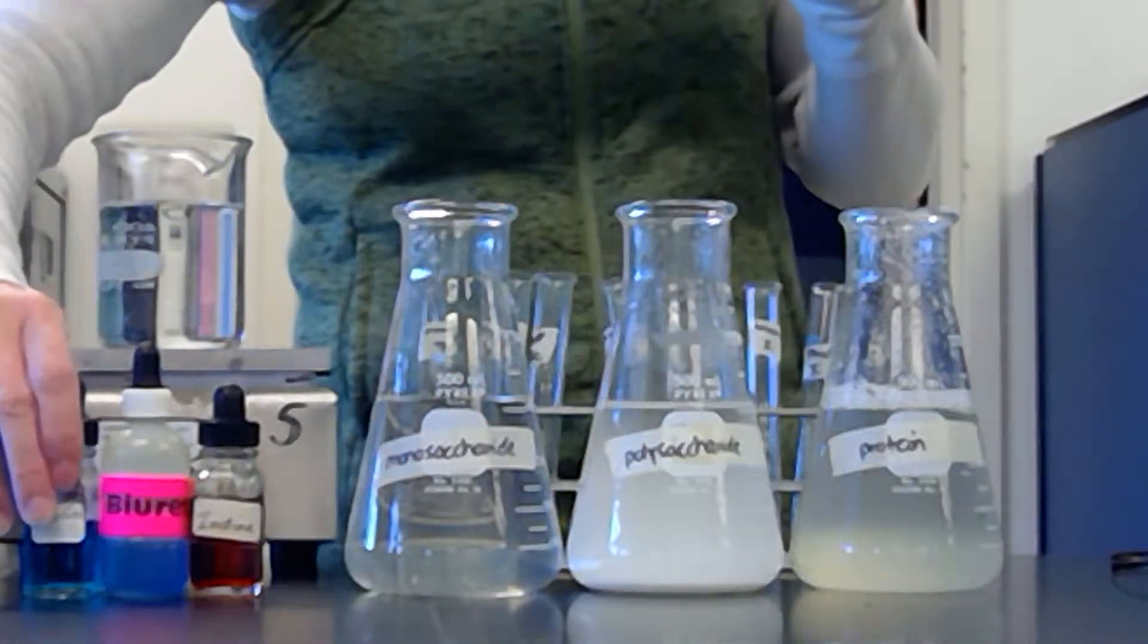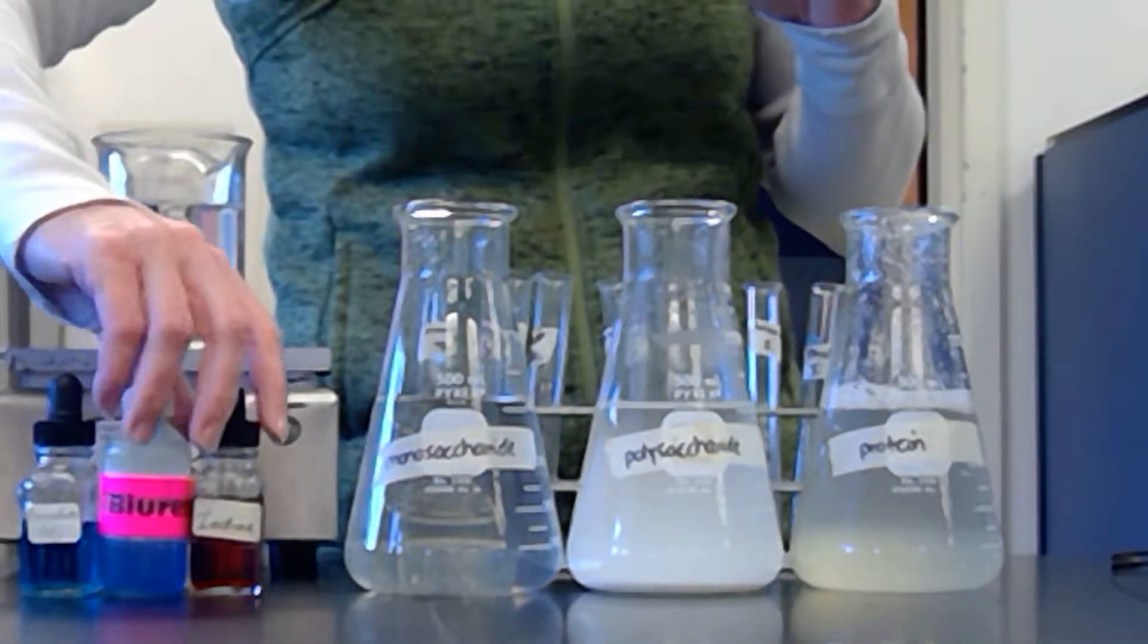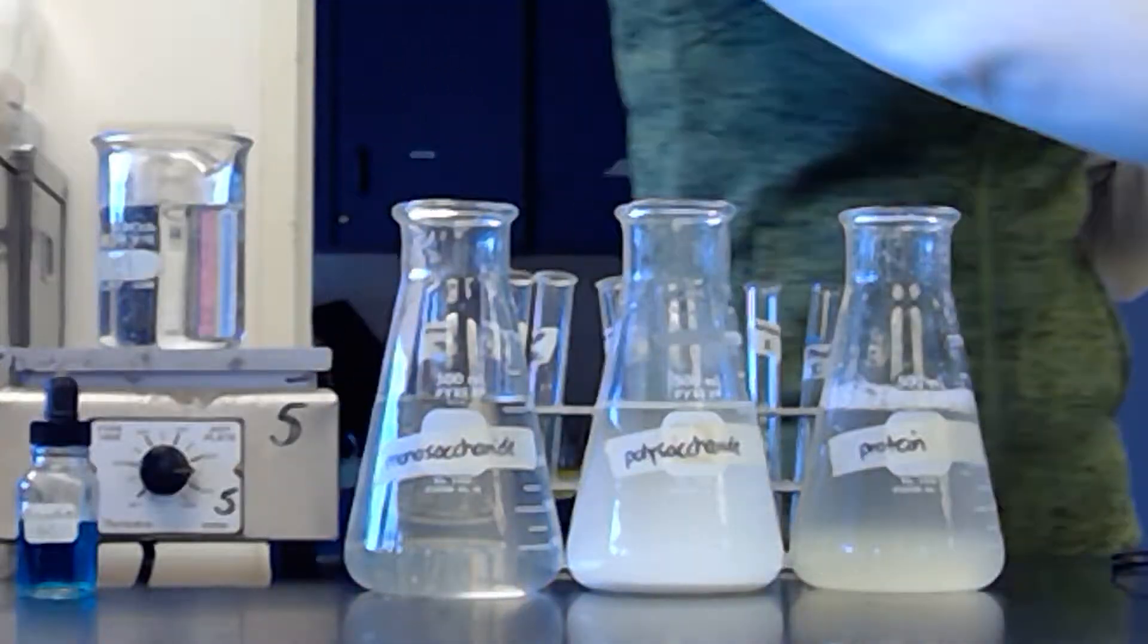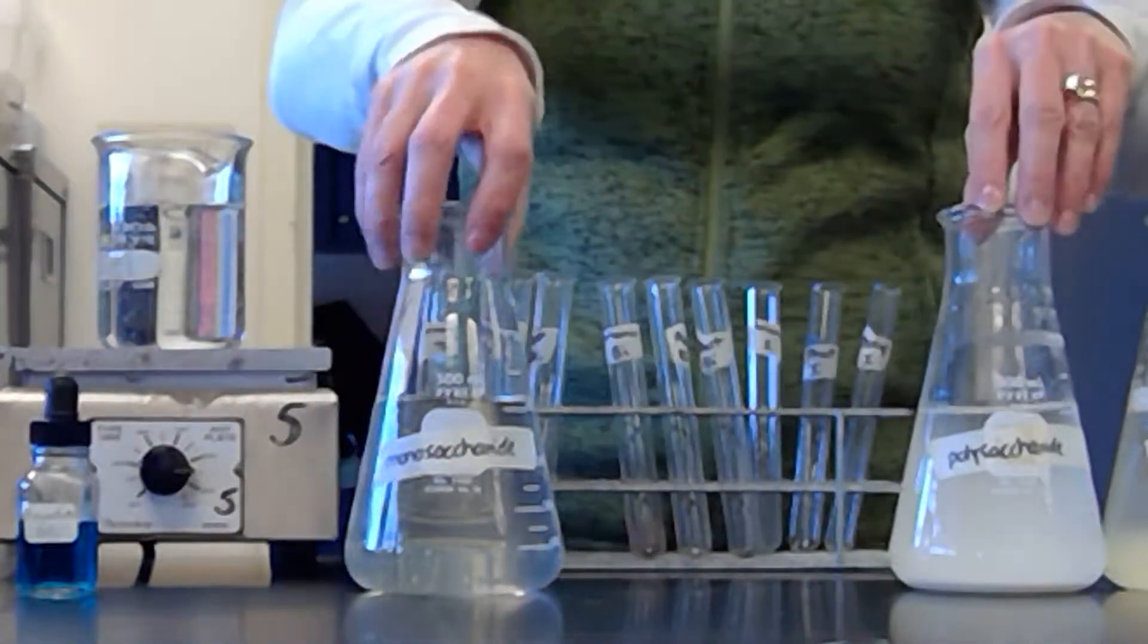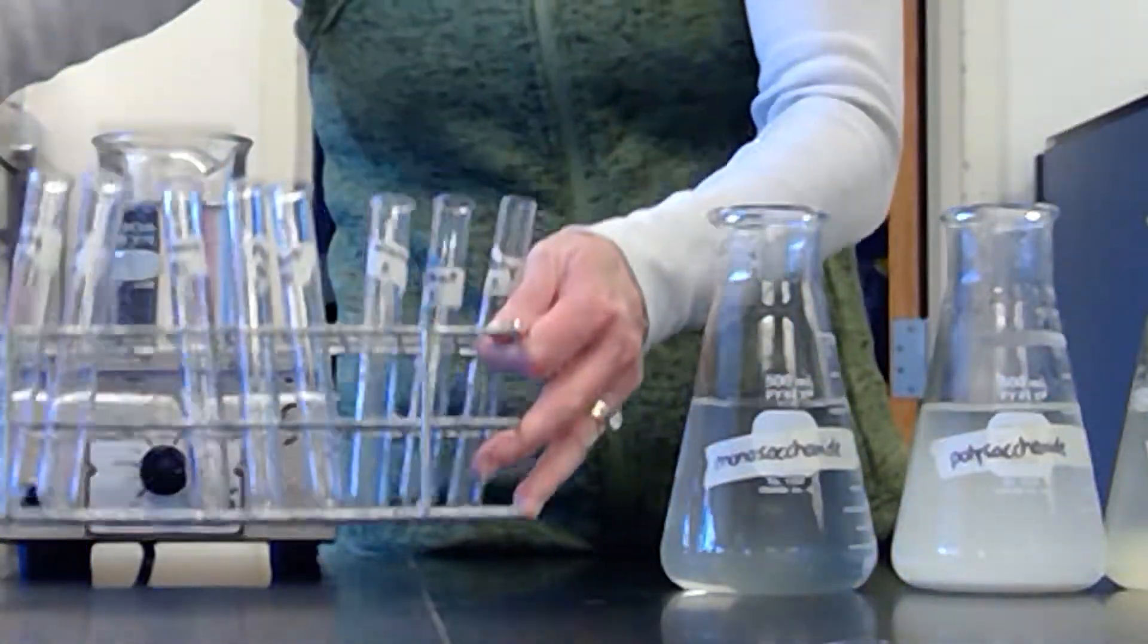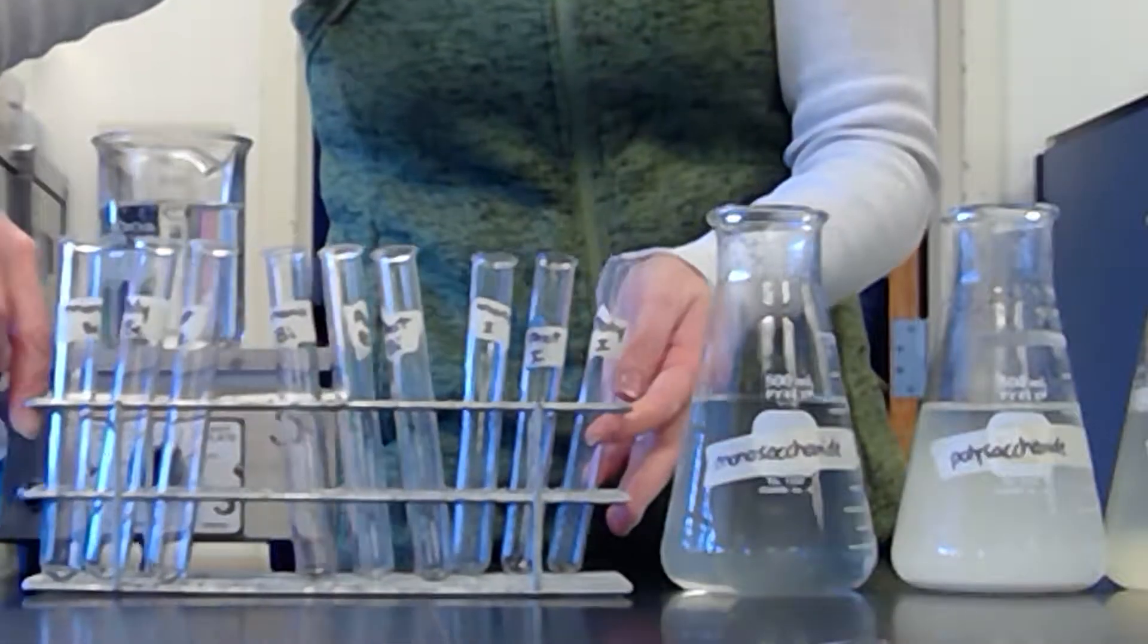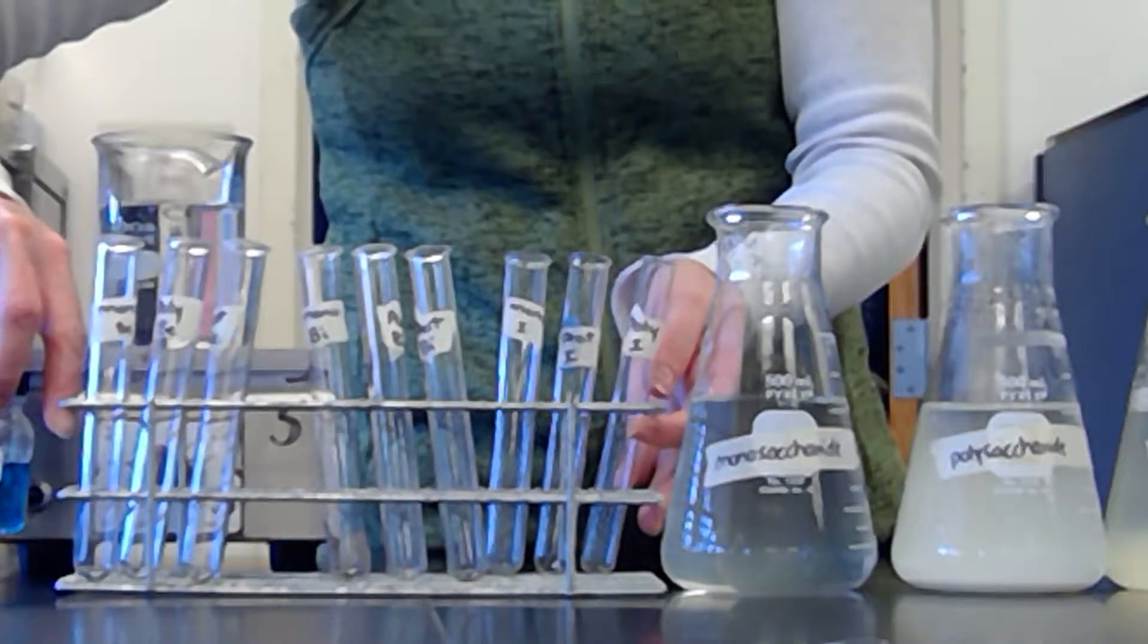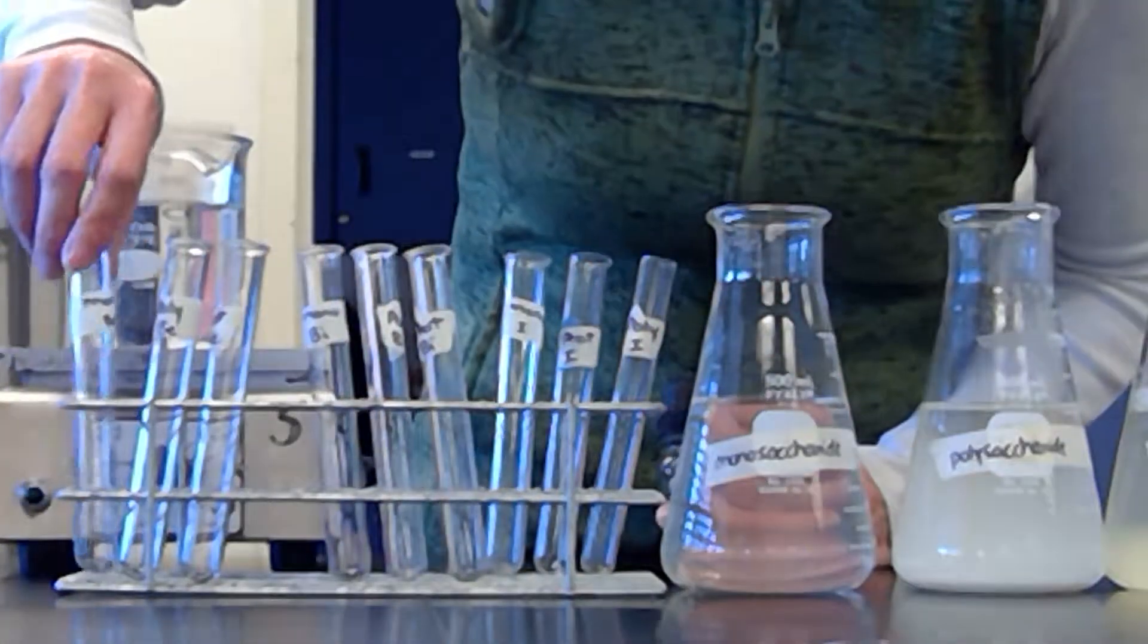I like to do an indicator at a time, so I'll test for Benedict's first for all three of the solutions, and then we'll go and we'll talk about the biuret and the iodine.